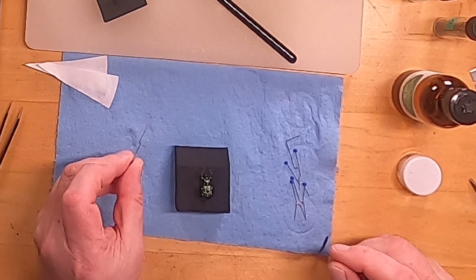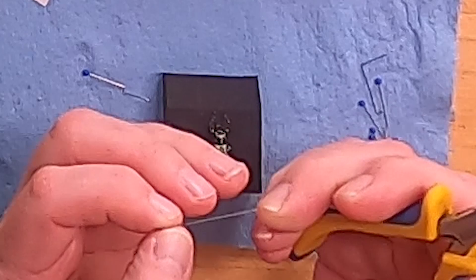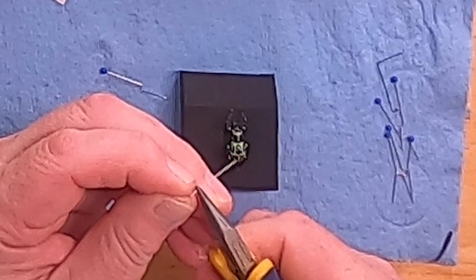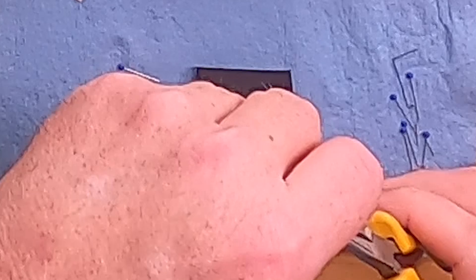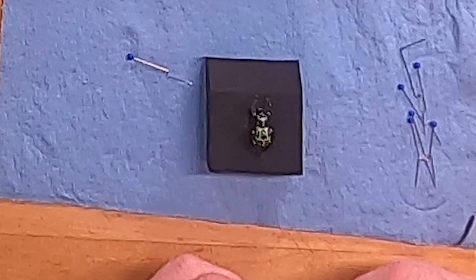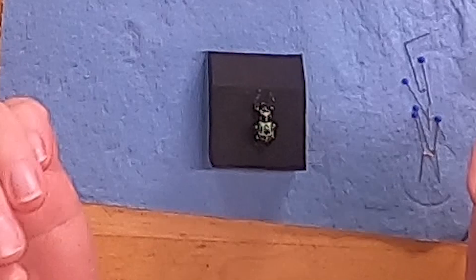They last longer if you don't pin through them. I'm going to take six pins and bend them like this — get a very fine pair of needle-nose pliers. You're going to bend the pin a little bit to one side of midway at 90 degrees, then go a little bit further down and bend the other half of the pin at 90 degrees in the opposite direction. I recommend you overshoot a little bit so it's like a thunderbolt shape.